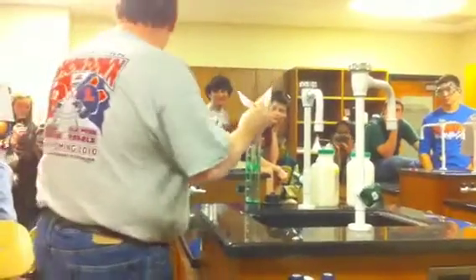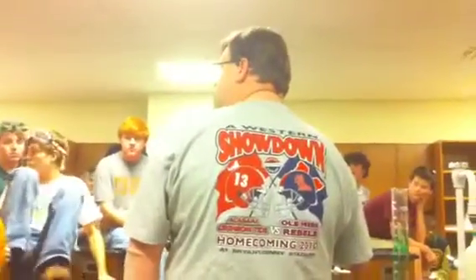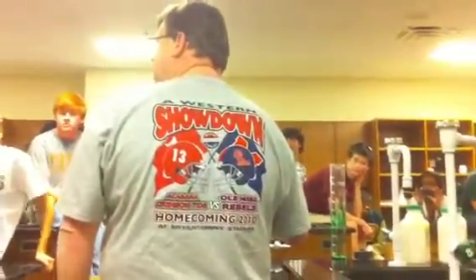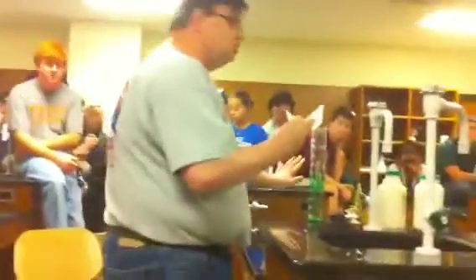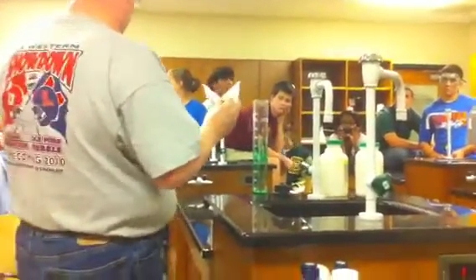After it's done, if you come and just put your hands close — do not touch the foam. After the reaction is done, your hands can come close, but do not touch the foam. It will stain your hands and it will burn. And you will die. It's fun.